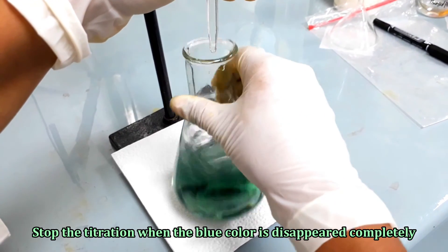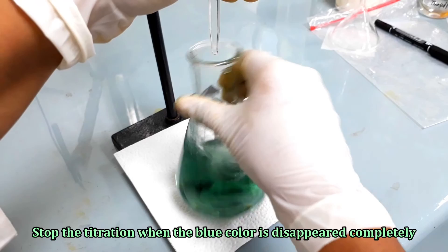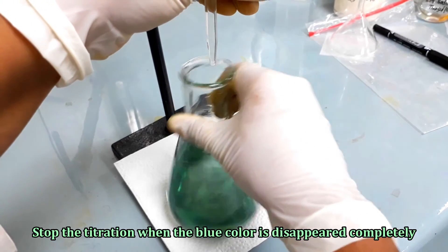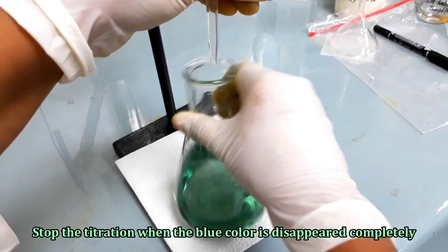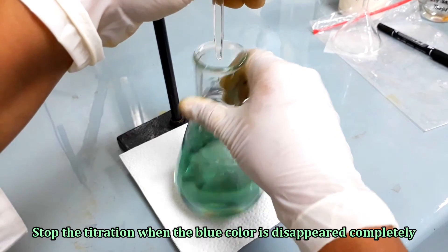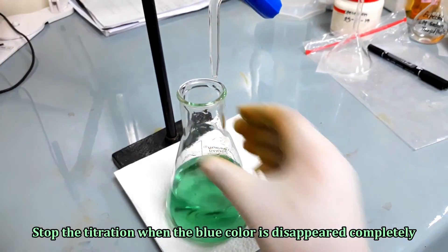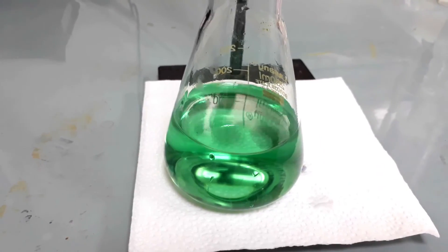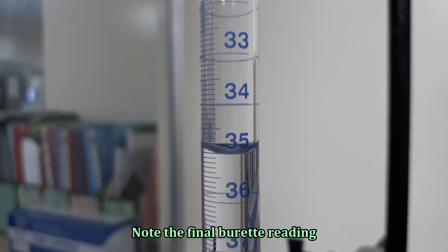Pause the titration. Stop the titration when the blue color is disappeared completely. Note the final burette reading.